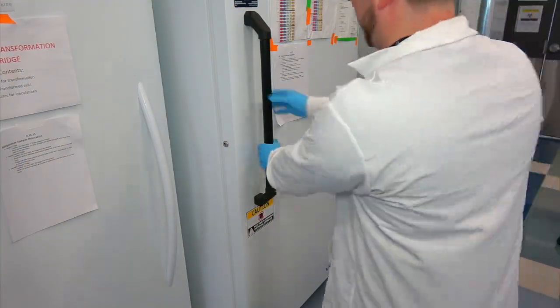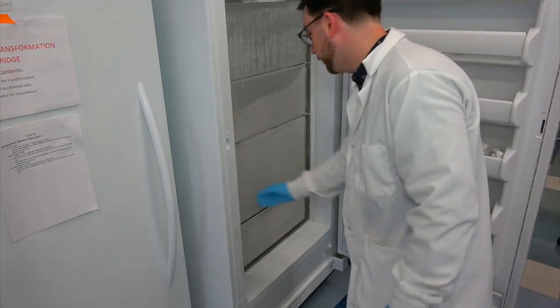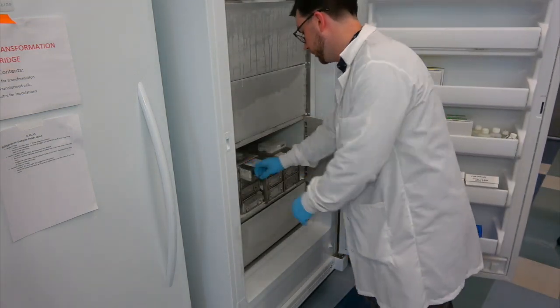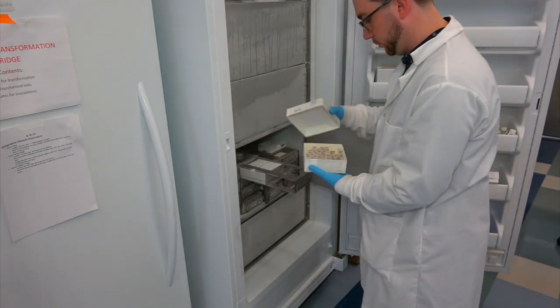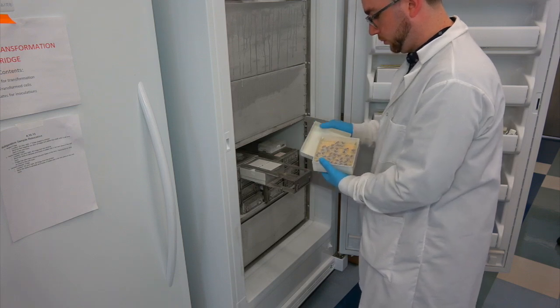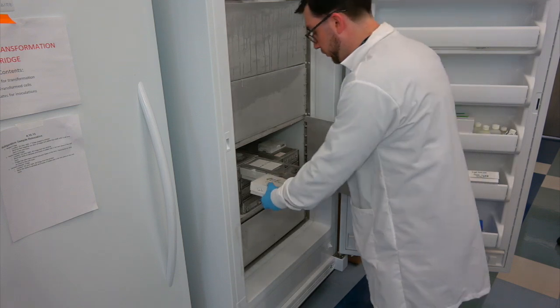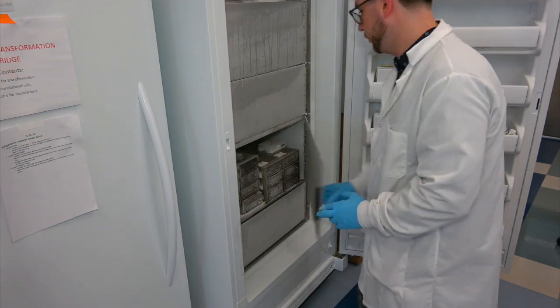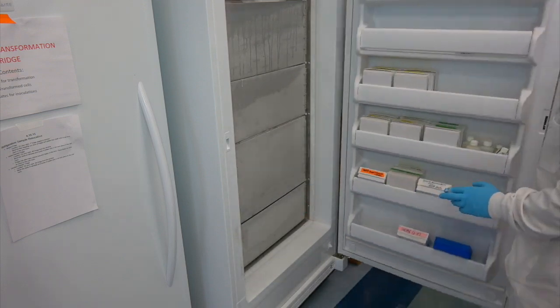Next, we take our antibiotic out of the freezer. We keep our antibiotics stored as 1000X stock solutions and dilute these as necessary. Most antibiotics can be stored in water, but some, like chloramphenicol, must be stored in other solvents, like ethanol. Check with the antibiotics manufacturer for further details.